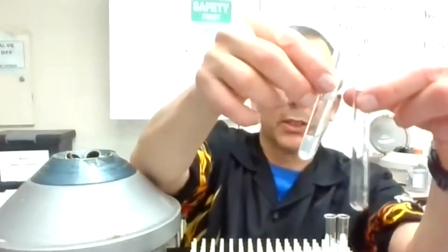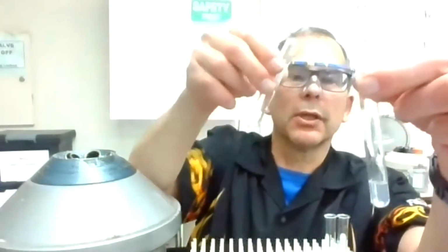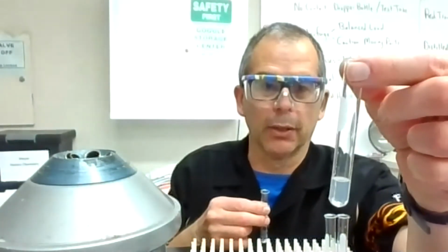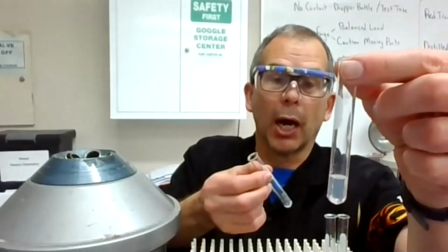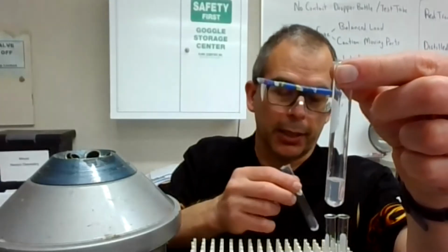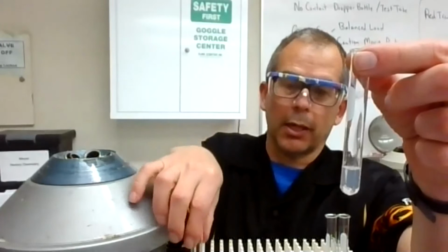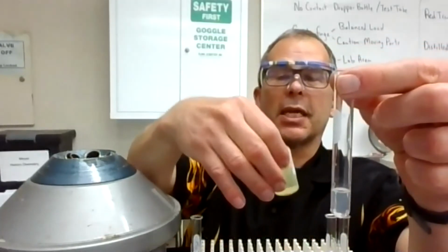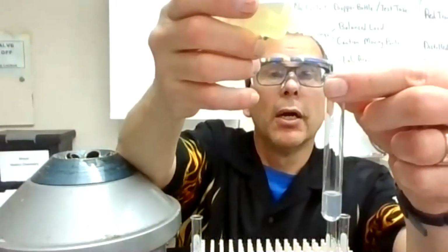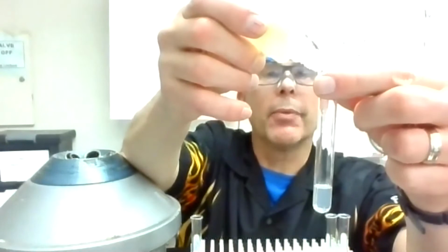So I have some rinsed clean test tubes. I'm going to transfer the solution to this. And notice there's a little haze that goes with it, but it still is quite clear. And I think we'll be able to distinguish whether we're getting reactions or not in the next step. And then here was the solid left behind, and I'll just put that right here. So the next step is to add FeCN6 minus 4. And most importantly, watch what's happening as I add the drops.